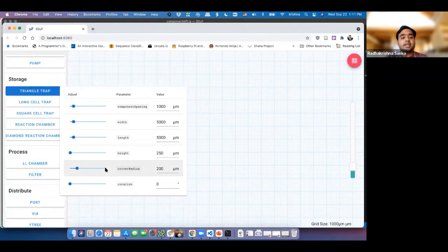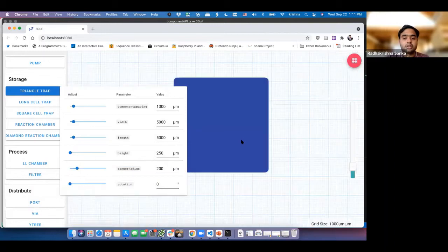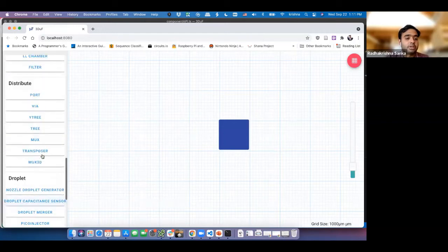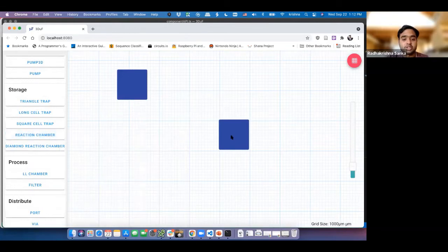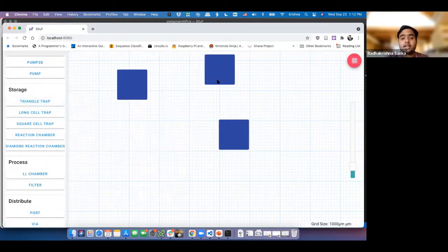So it treats it exactly like a chamber. If I click on this, sorry, I was zoomed out. It creates exactly a chamber, because what we did was we copied all the definition of a chamber, and it just draws a rectangle for us, which is the same thing as a reaction chamber. Because we copied the drawing code and the definition for a reaction chamber, triangle trap is also basically just drawing the same thing. Now, we need to add a little triangle into it. This is the main, actually hard part of doing any kind of 3D component design. And it's also not very hard. Within an hour or so, it's very easy to add a whole new component into the design.